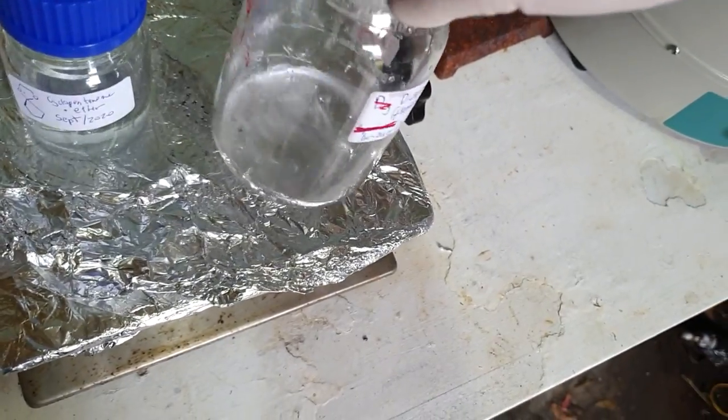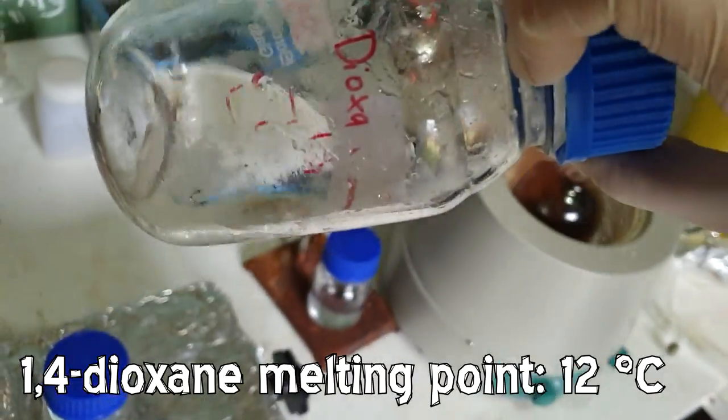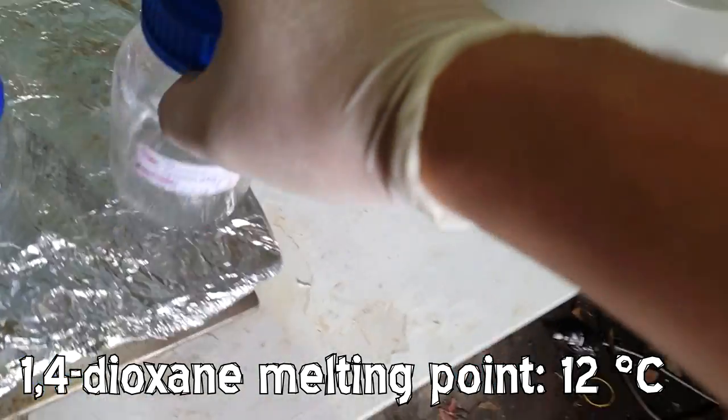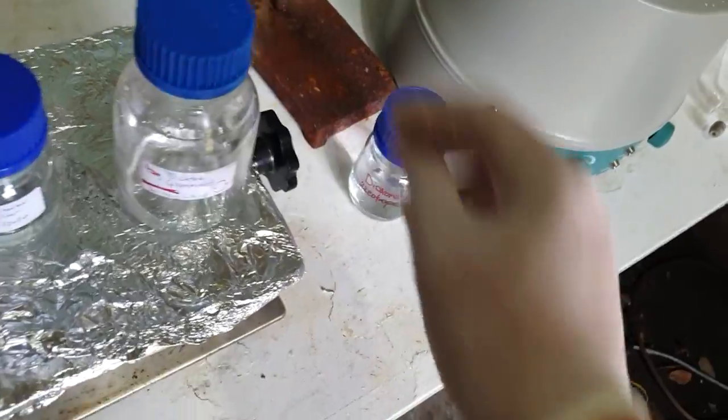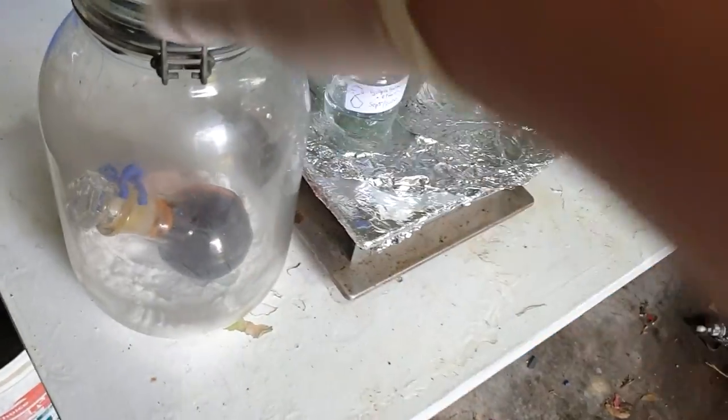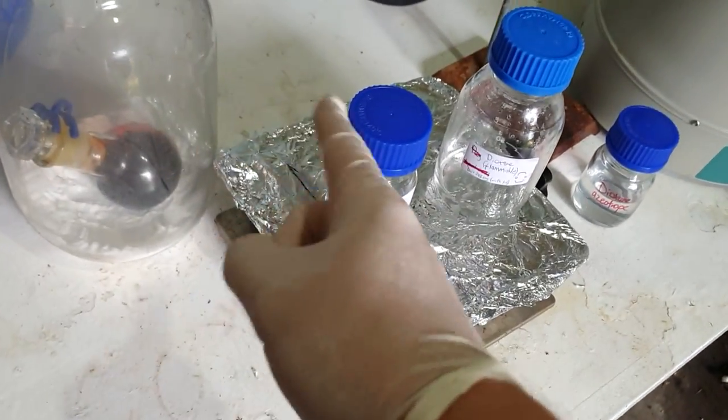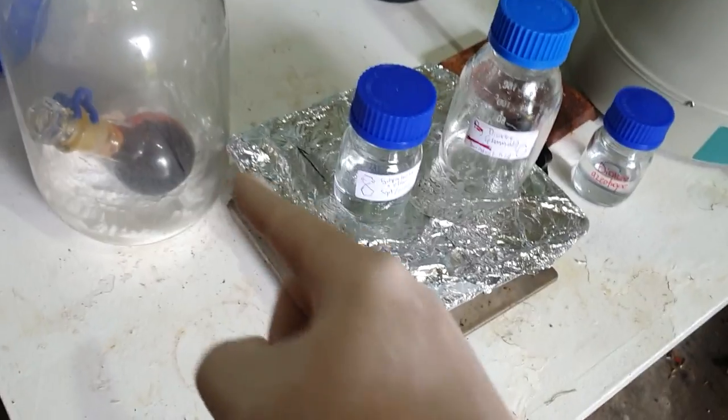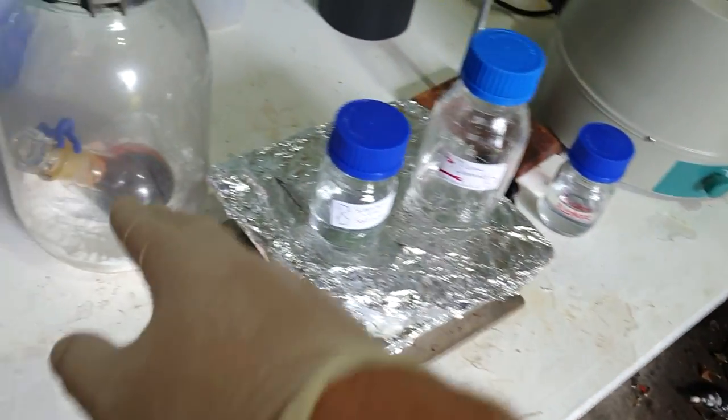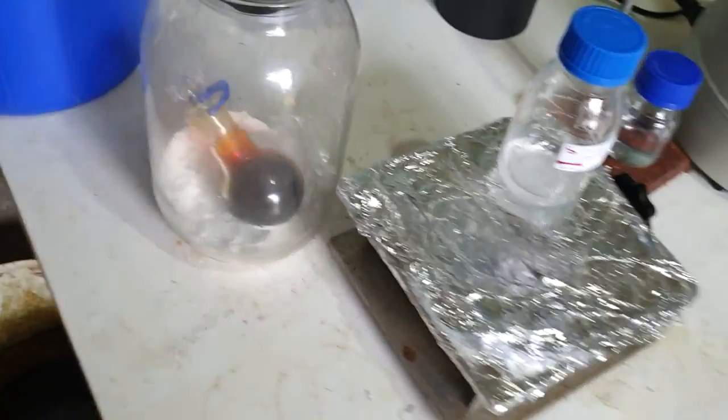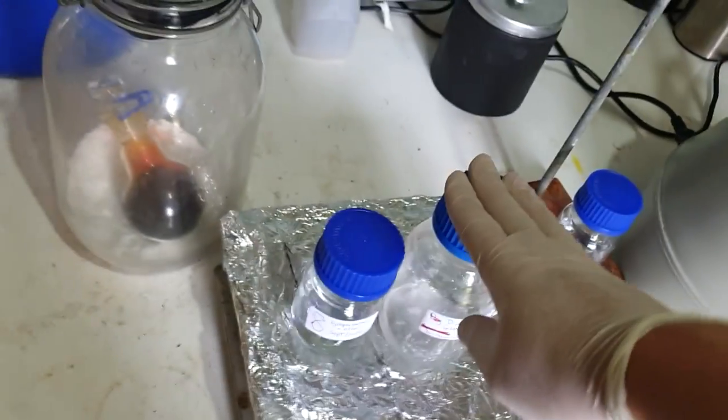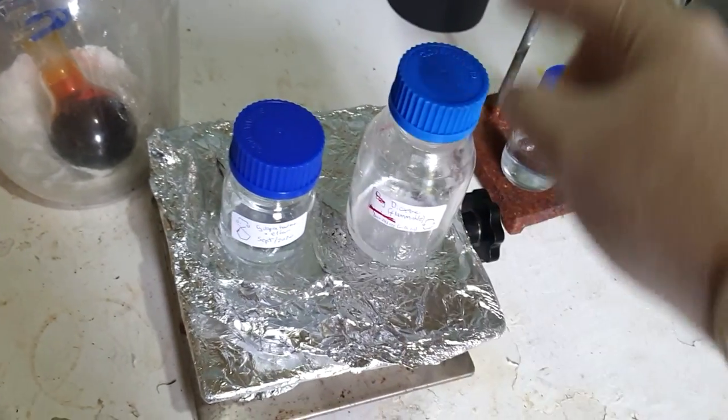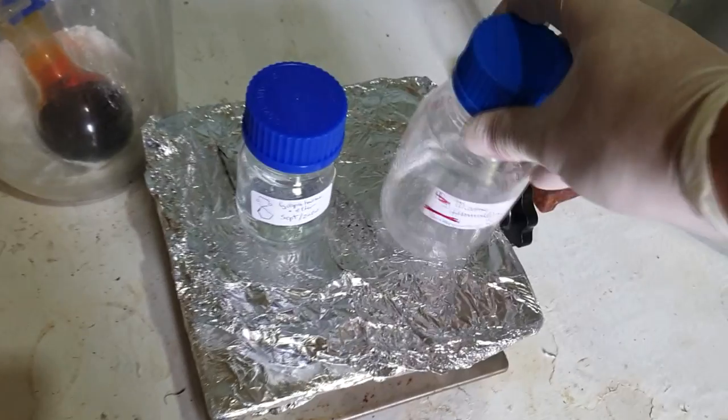This is all we have for the dry stuff—it's about 30 mils. It's got some solid stuff down there which is itself freezing because I put it in the freezer or the fridge and it started to solidify, which is a really good sign of purity. We have a lot of this stuff—it's probably more concentrated than the azeotrope, which explains where all our dioxane went. But it's still too wet for our purposes, so I'll need to redry that if we hope to use it in this reaction. This is our bromine—it's over sulfuric acid. I've got a hot tip from Eric who's done this reaction before and sent me some tips on Discord. The bromine contains some sulfuric acid after you dry it with the sulfuric acid, so I'll need to redistill the bromine because the bromination reaction that we're doing is particularly sensitive to acid. So we'll need to make sure there's no acid there. I need to redistill the bromine. Could film it but honestly I'm not going to because I'm sick of distillations at the moment. I'm sick of filming distillations—done nothing but distillations recently. We've got our dioxane, we've got our bromine, we've got our cyclopentanone ketal ether thing. Should be all good to do a run of the bromination step. I have purchased some TLC plates, so I'll be able to monitor the reaction that way. I hope you enjoyed this and I'll see you in another video soon.